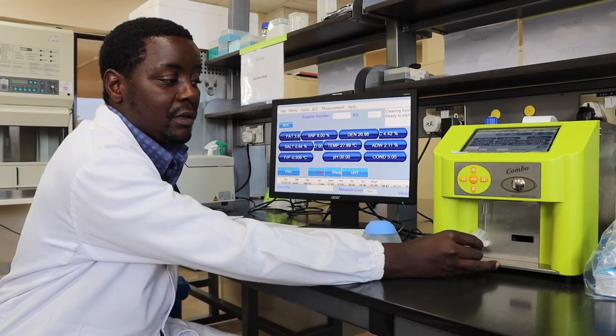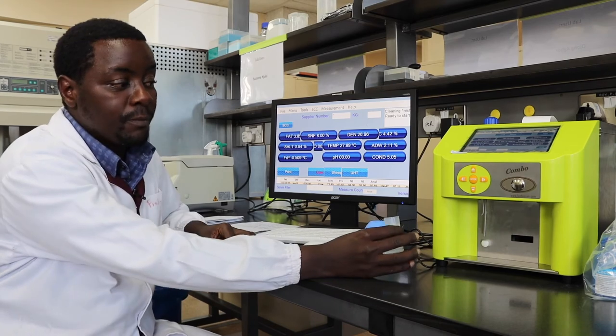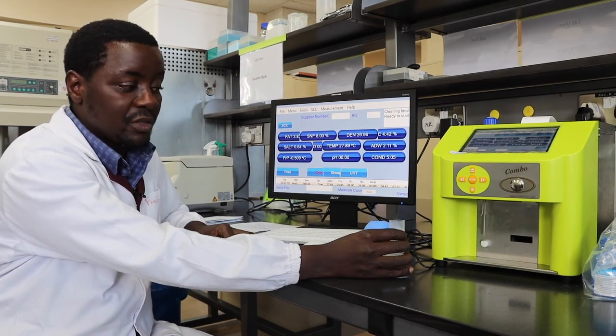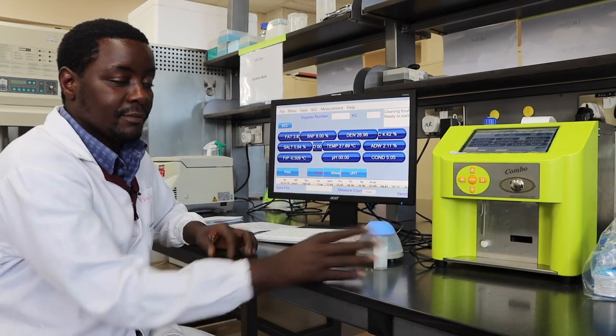Make sure to remove the clean solution from the sample introduction unit. That's it.